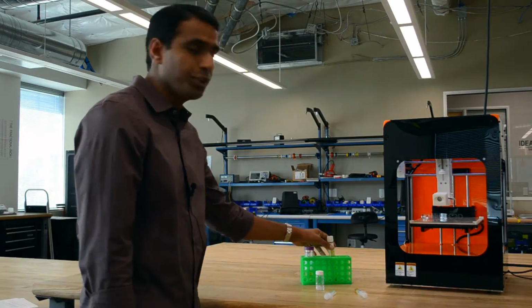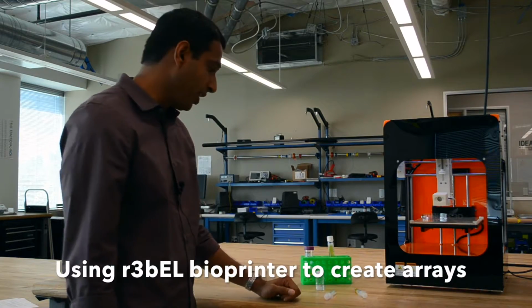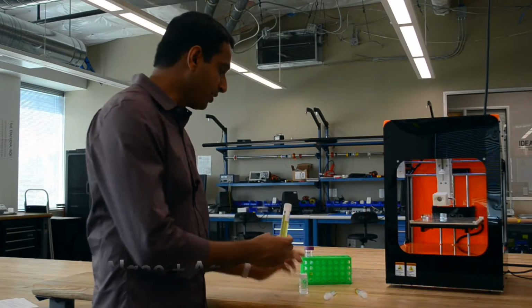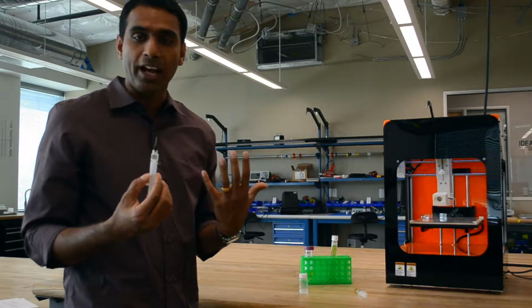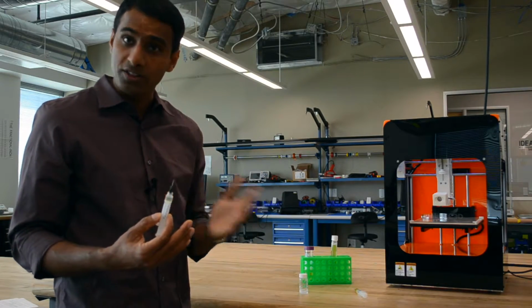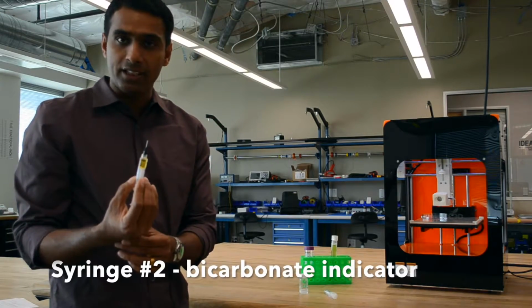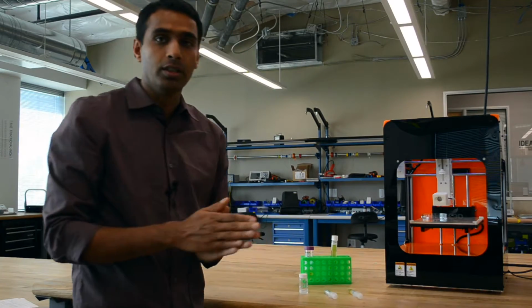Okay, now we're going to move to the second phase of our demo. We're going to use the bioprinter to create algae-based arrays. For that, we're going to mix algae with agarose to create this first syringe. We're doing this so that agarose is able to encapsulate algae and prevent it from escaping the array once it's printed. Next, we're going to also create the second syringe, the bicarbonate indicator, in order to visualize the photosynthesis.